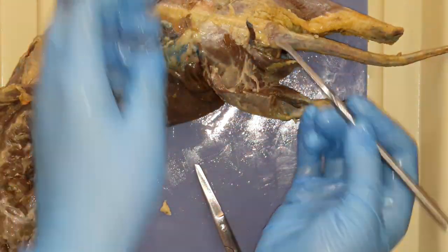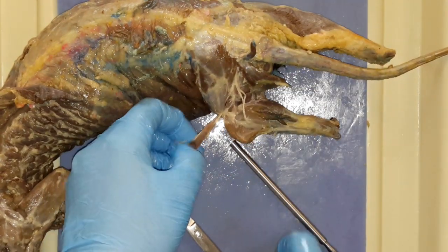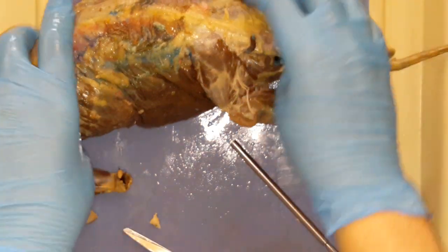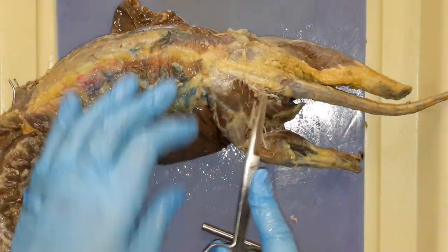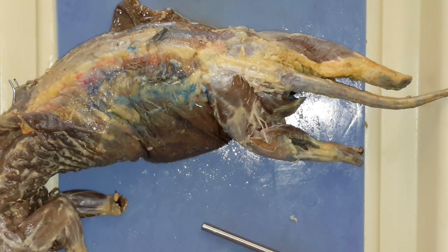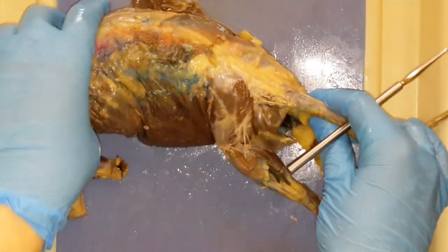So I already cut off the top edge, and then down at the bottom — now I'm all the way to the tendon, so I can just trim that little sucker right there, and it's gone. And that is going to help us see some deeper muscles. This needs to be cleaned even more. Actually, when you're cleaning over the gluteus maximus or the medius, those muscles that have connective tissue, it's kind of hard to remove the connective tissue here. So as long as you see the outlines of the muscles, I'm pretty happy.